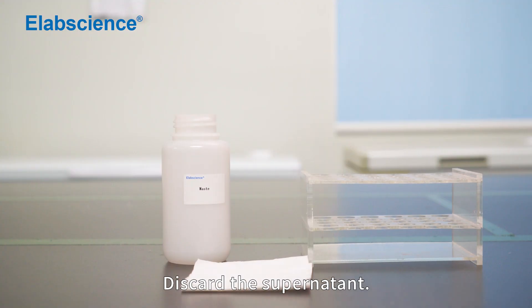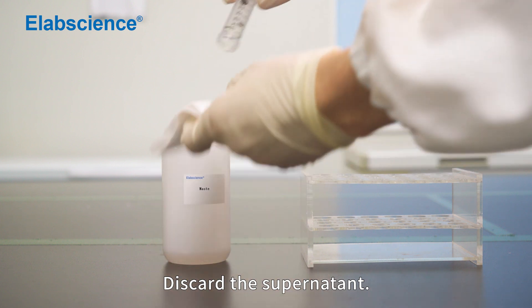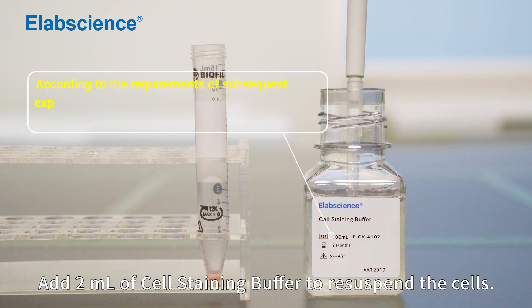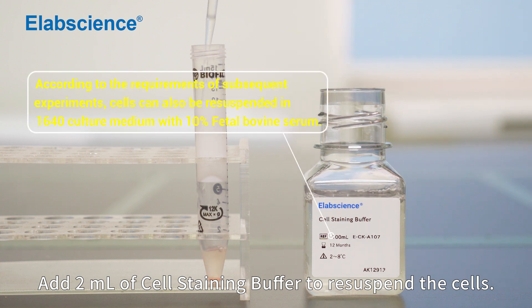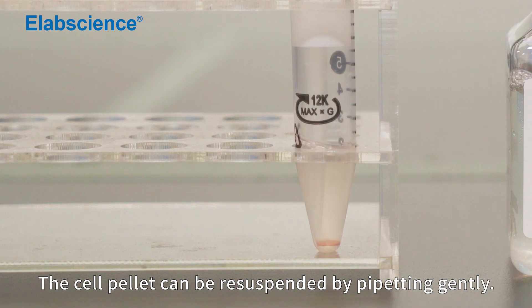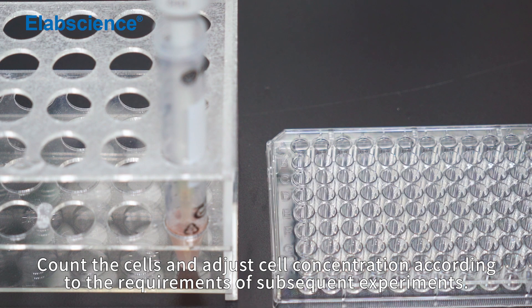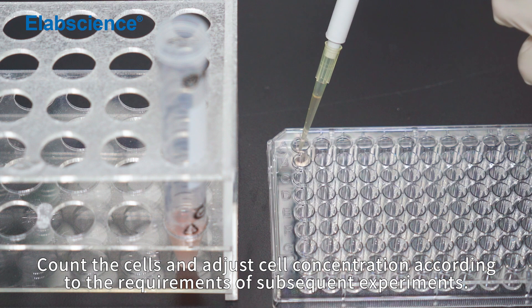Discard the supernatant. Use the staining buffer to resuspend the cells. The cell pellet can be resuspended by pipetting gently. Count the cells and adjust their concentration according to the requirements of subsequent experiments.